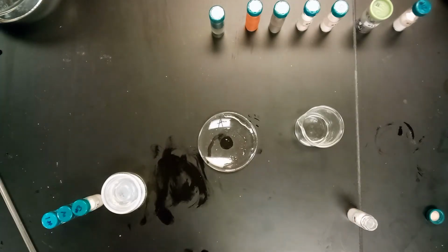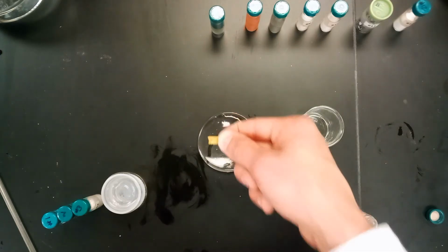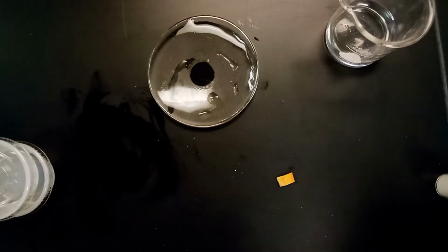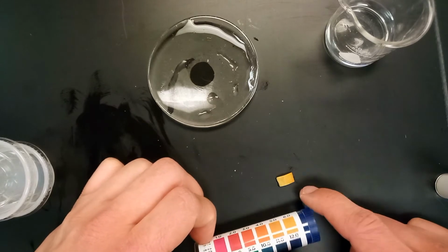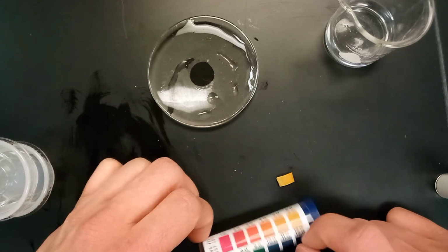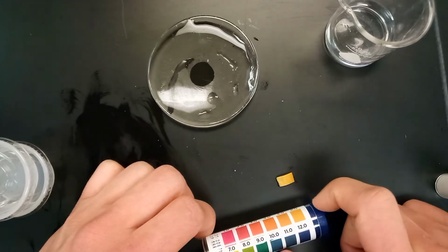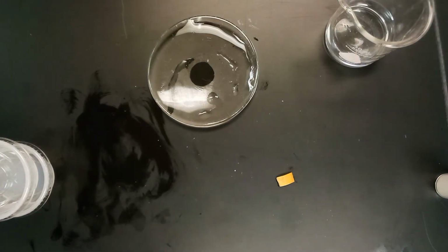We'll also go ahead and take a little piece of pH strip, just to get a good amount on it there. We'll compare the color now. Hopefully you can see here, I'm not sure how well it's coming through, but it's kind of orangish on the right, but a little bit green on the left. We'd say this probably is somewhere between the 6 and 7 range. It's not quite as yellow as this, but it's not quite as orange as this. So this has a pH of about 6.5 is what we'd probably say, which is kind of the only data point you really need for this one.